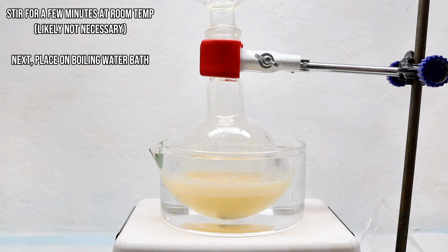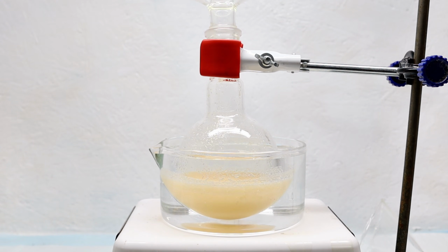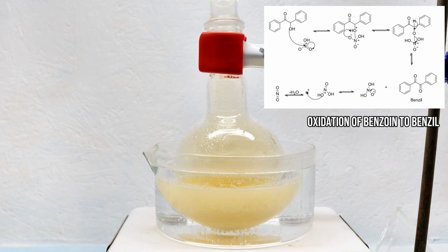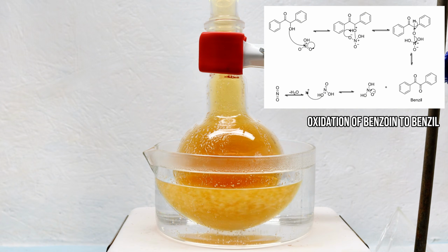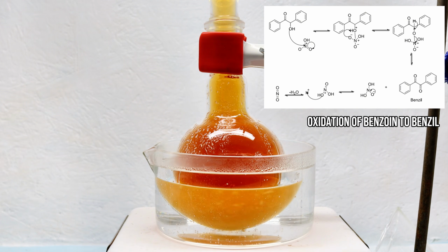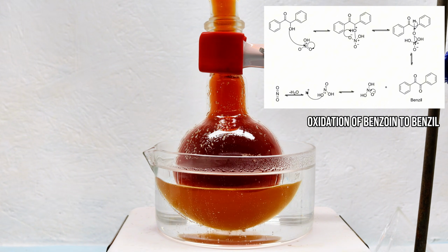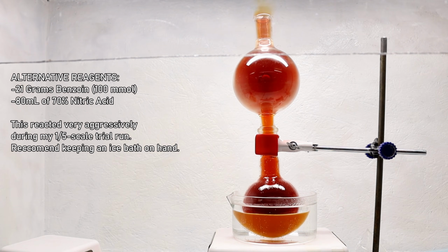I also connected a trap to the reaction flask in order to prevent this from possibly boiling over, but I don't think it was necessary. Once the reaction did finally get going, it was accompanied by the evolution of toxic red nitrogen dioxide gas. Most of this gas collected in the trap, which I thought looked pretty cool. Now what's happening here is a fairly basic oxidation of benzoin, which is an alpha hydroxy ketone. When the hydroxyl group of benzoin is oxidized, we get a 1,2-diketone, which is Benzil.